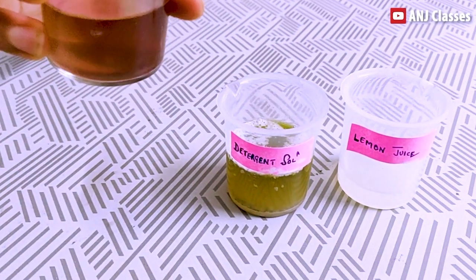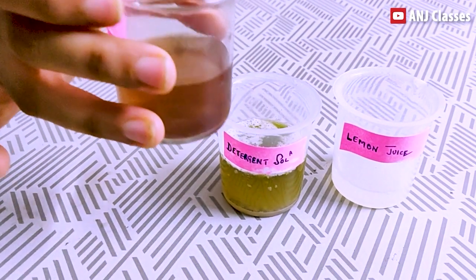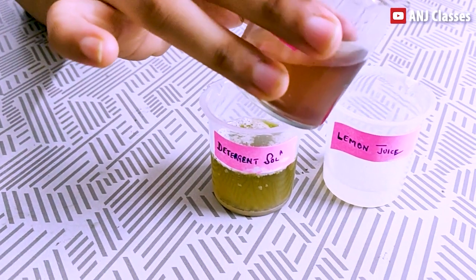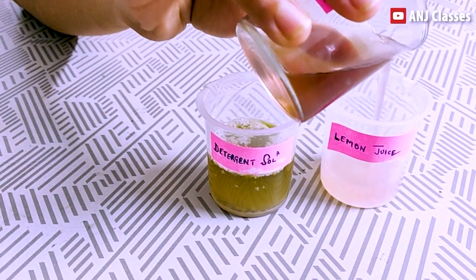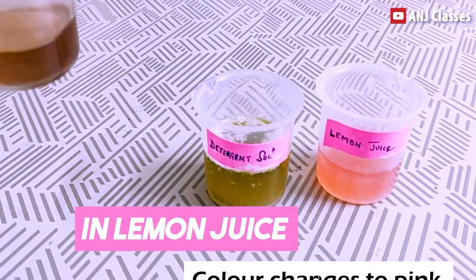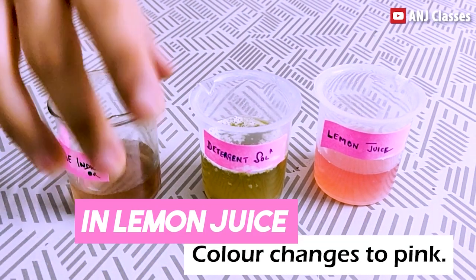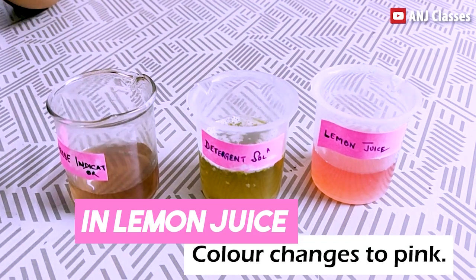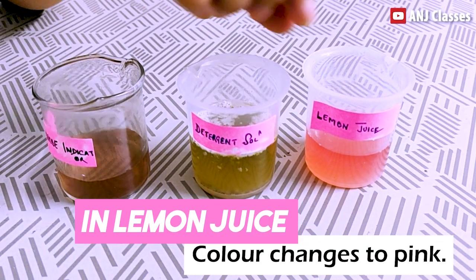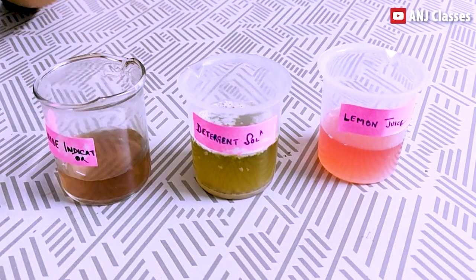Now I will pour my China Rose Indicator into the acidic solution, that is my lemon juice. Here you can see the color changes to pink. So this indicates lemon juice contains acid.